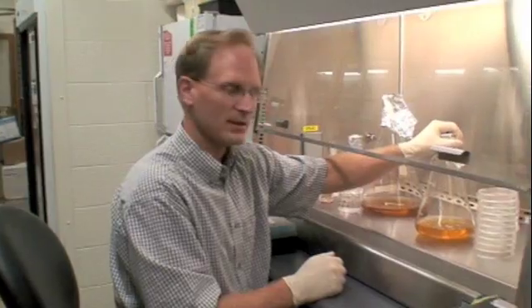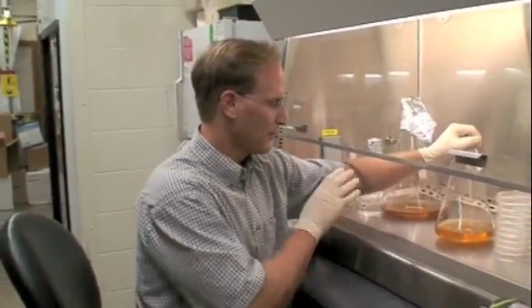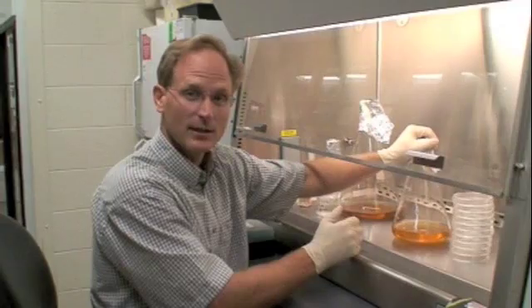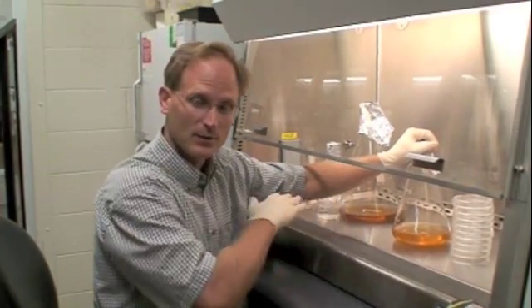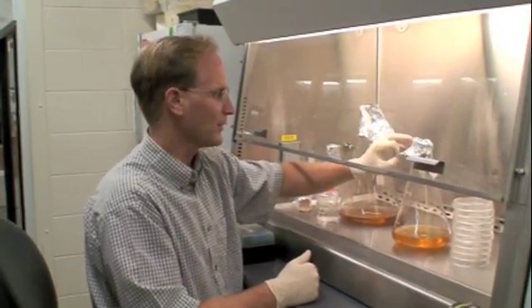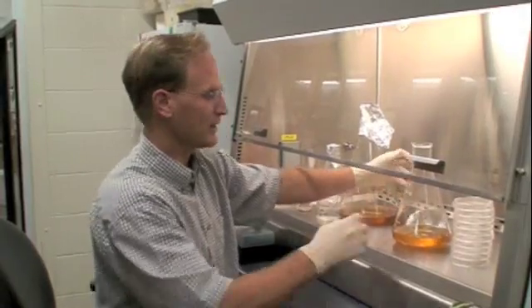Generally what we're going to do as a class is put the ampicillin in now, let it cool, let the plates harden a little bit, and then we'll put the IPTG and X-GAL on top of that and spread it. So we're just surface treating the plates with those two reagents for the screening process.